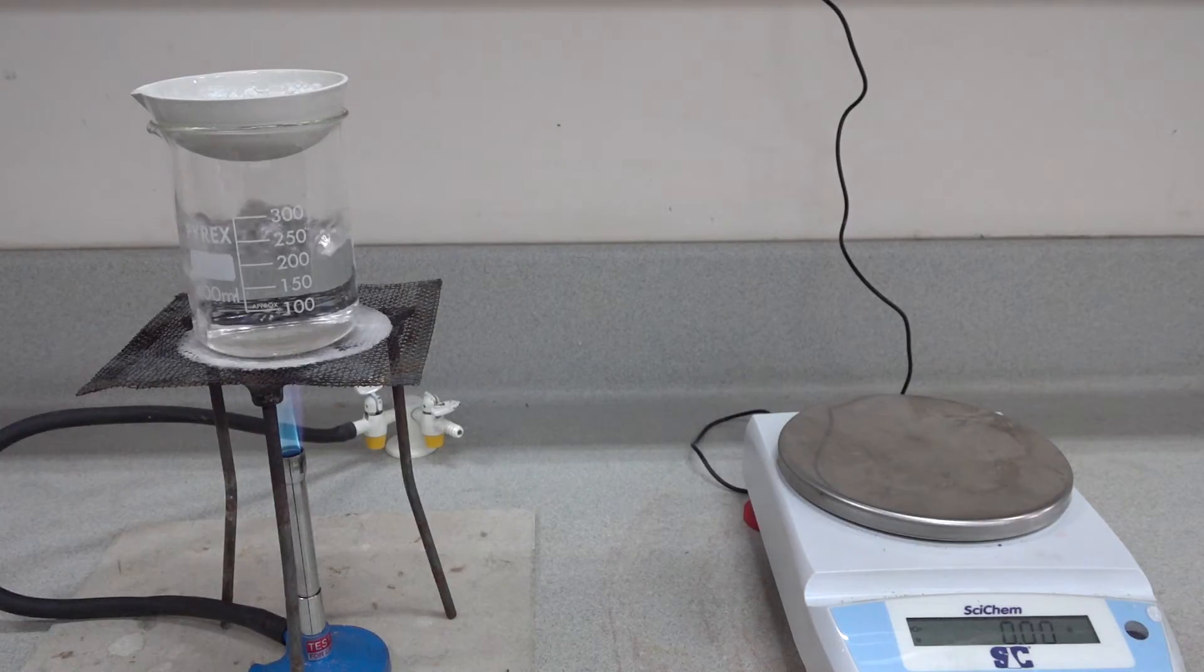We weighed the evaporating basin before and after adding the solution, and we've evaporated the solution to dryness over a boiling water bath.